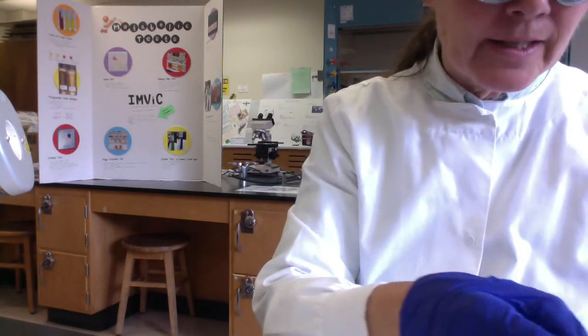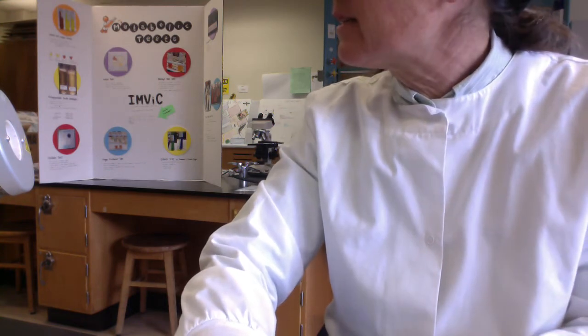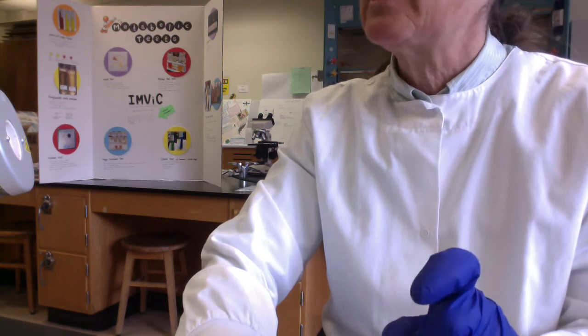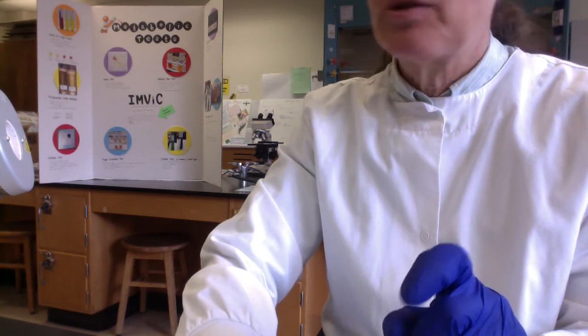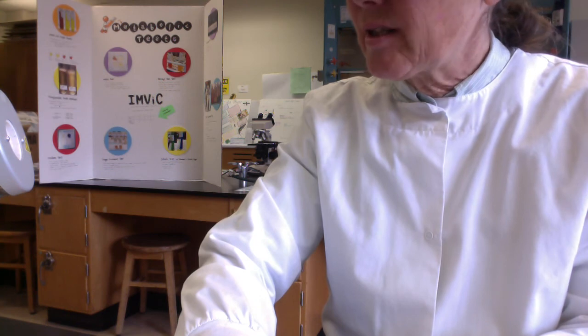All right, folks, so that's that for blood agar. And let me see here, the next demo we're going to do is, let's see here, we went from chapter 10, microbial growth media, and then I think we did chapter 11, aseptic transfers. So we'll look at our broths, our slants, and see what kind of results we got.